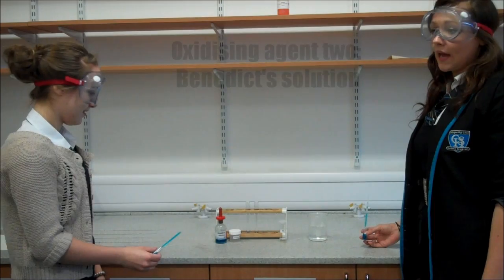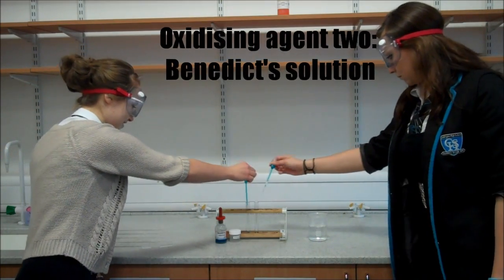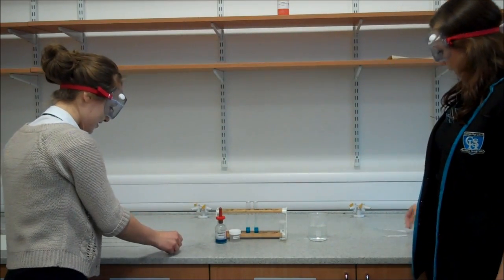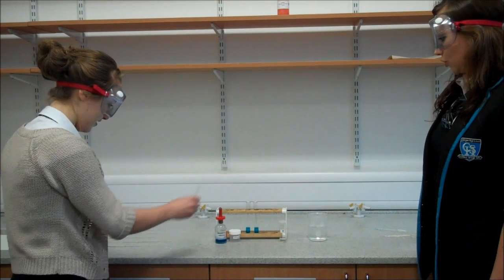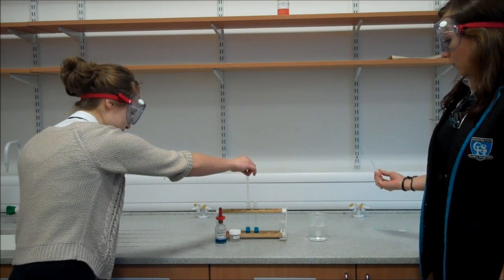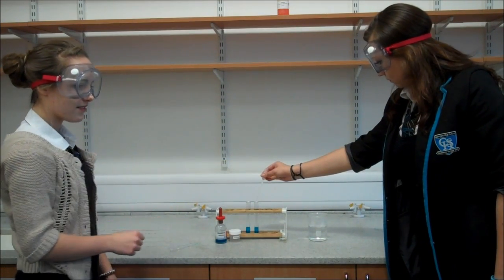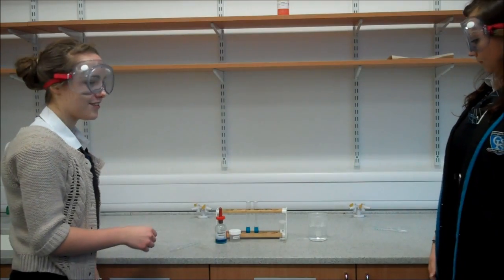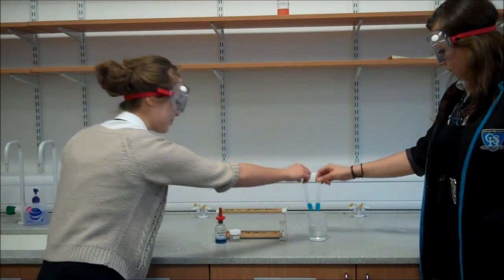To two test tubes in the rack, add about 3cm of Benedict's solution to each. Next, add about 5 drops of compound X to one test tube and 5 drops of compound Y to the other. We then place both test tubes into the beaker of freshly boiled water to provide optimum temperatures.